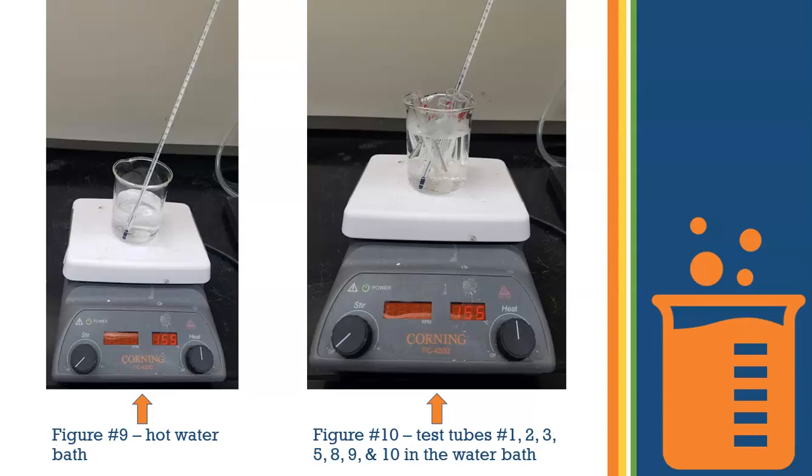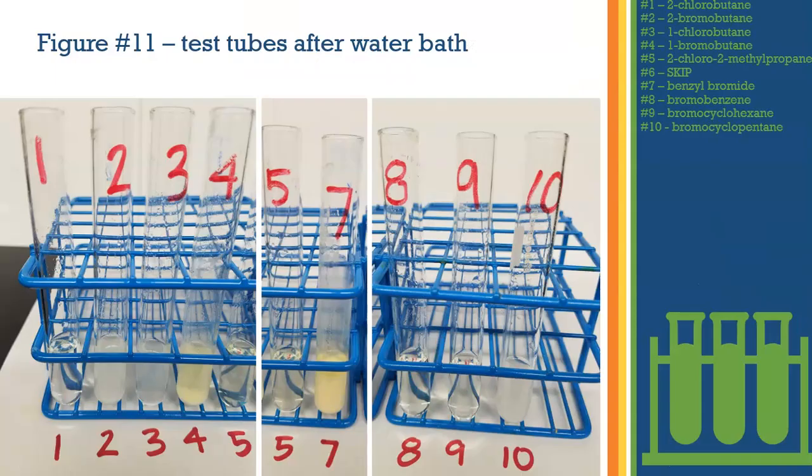A hot water bath was prepared at 50 degrees Celsius, and test tubes 1, 2, 3, 5, 8, 9, and 10 were placed in that hot water bath for 1 minute. After the test tubes were removed from the hot water bath and allowed to cool to room temperature, this is the final results for all of the test tubes.